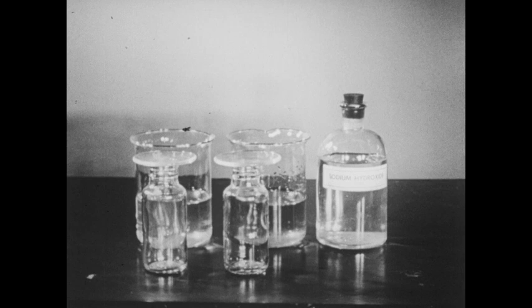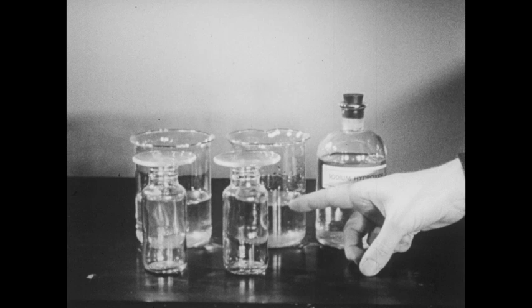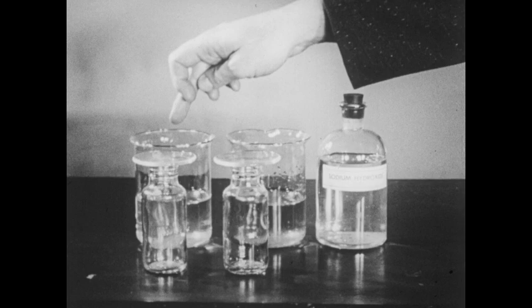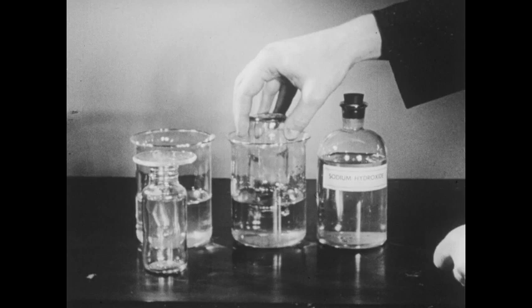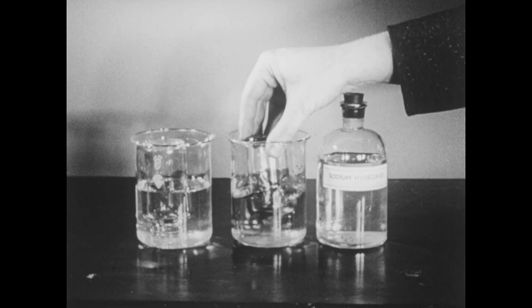The next experiment will test the solubility of hydrogen sulfide in water and in sodium hydroxide solution. In this beaker, we've placed some sodium hydroxide solution and some water to dilute it, with a few drops of indicator to impart a pink color. This beaker contains water. We'll place a bottle of hydrogen sulfide in each of the beakers and agitate to bring the gas and the liquid in contact.